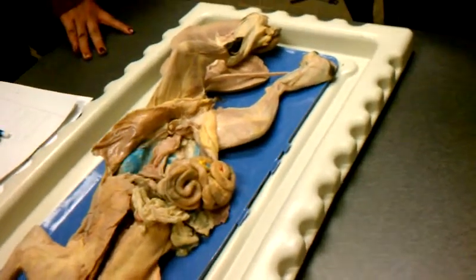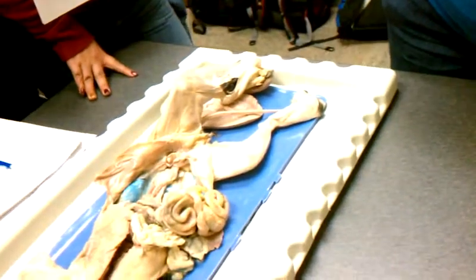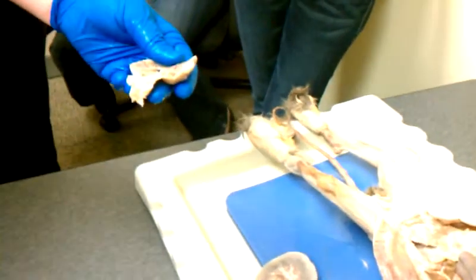Are you going to do it sort of like last time where it's kind of more head to toe? Yeah, I will try to go, and so it's easy to see the number. Kind of trace down. Yeah.